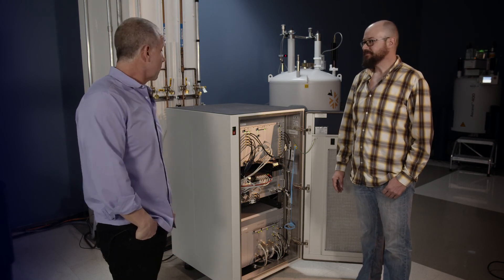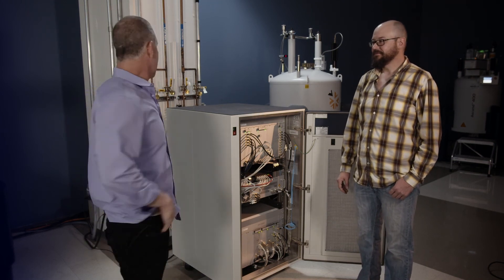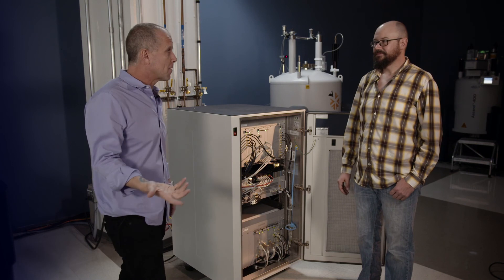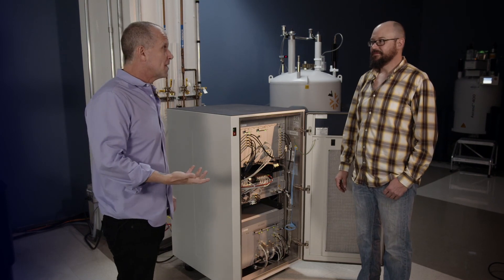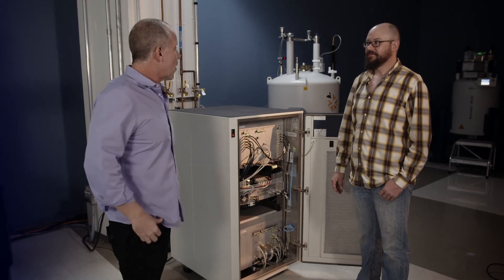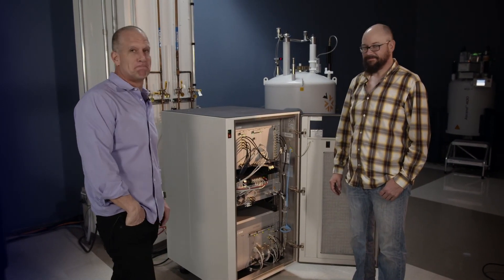Thanks for giving us an overview of a modern NMR system and the components involved in that. Thanks.